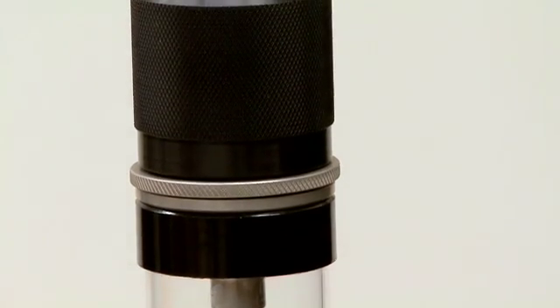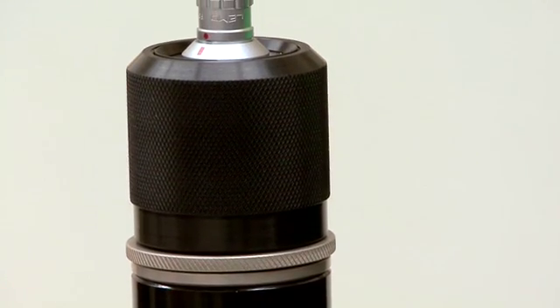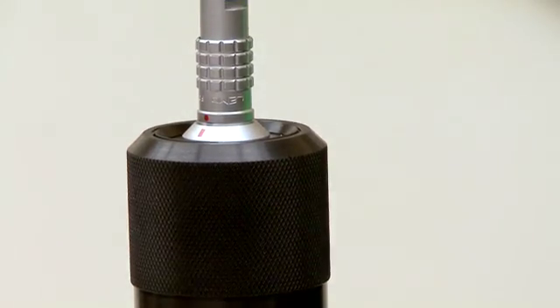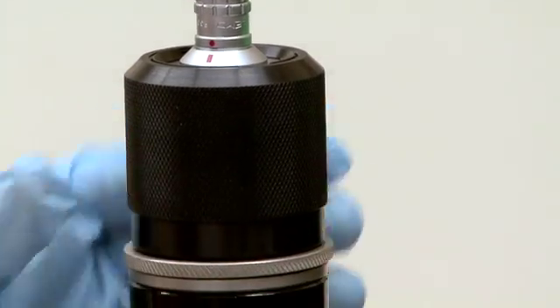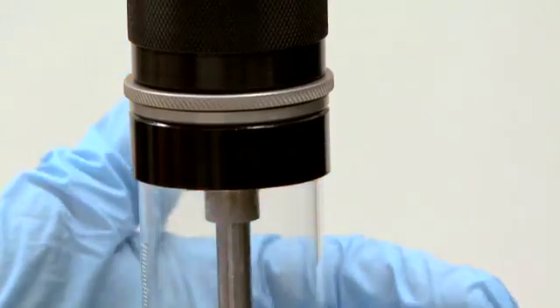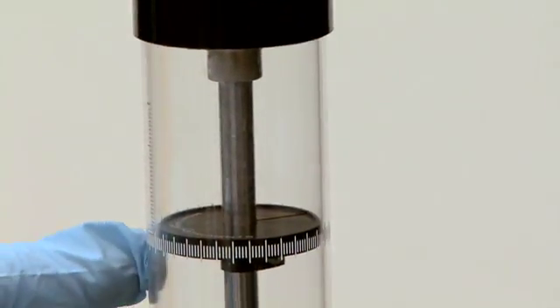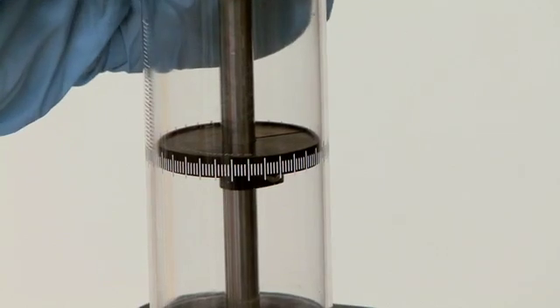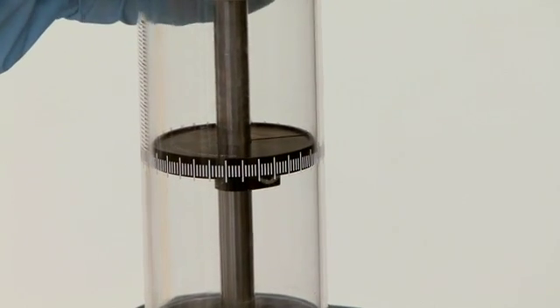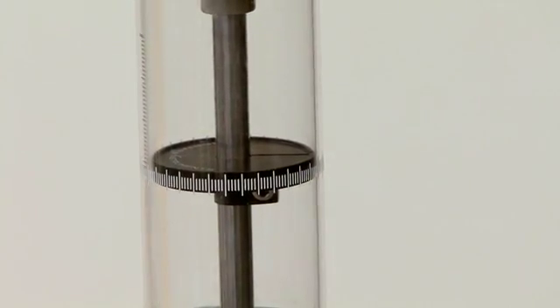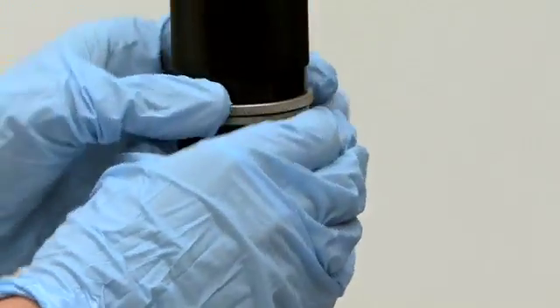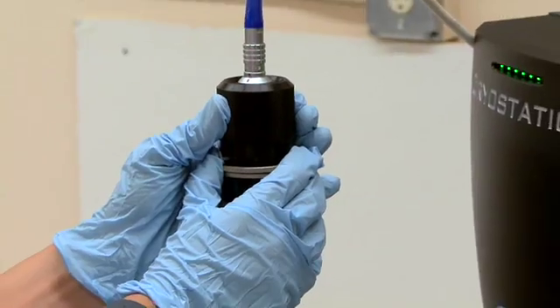When your sample is cold you have the option of manipulating the sample within the sample chamber with respect to the optical axis. To do so you can loosen the knurled nut and there's a black disc that has a cutout and using the ticks on the outside of the glass insert you can tell where your sample is. You also have the option of manipulating the sample vertically within the sample chamber by lifting up on the top of the sample rod and then tightening the knurled nut.